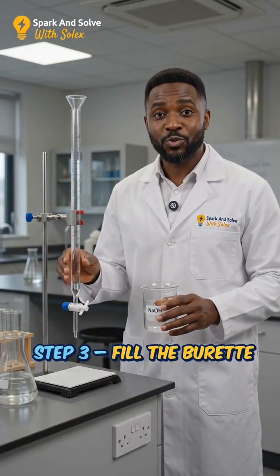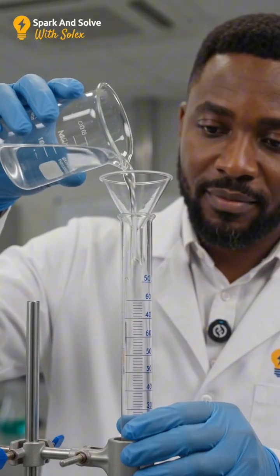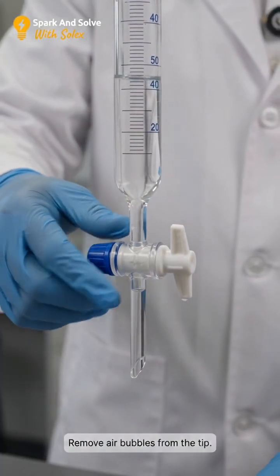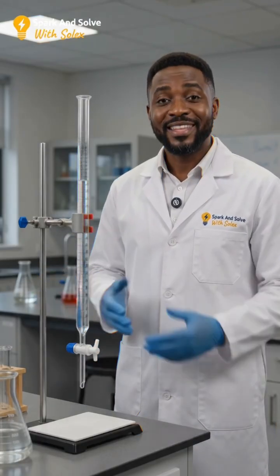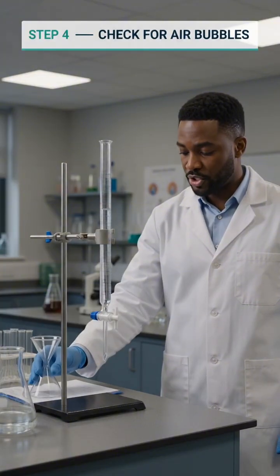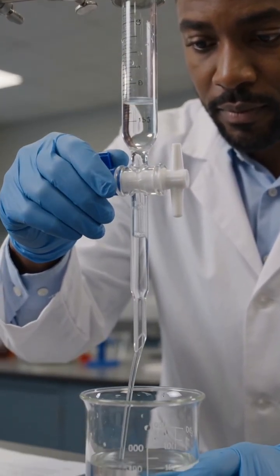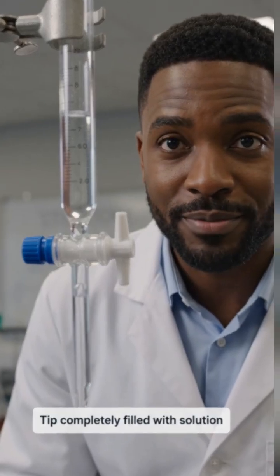Now fill the burette with the standard solution. Make sure the solution fills the tip and there are no air bubbles. Remove the funnel before titration and check the tip carefully. Make sure there are no air bubbles.